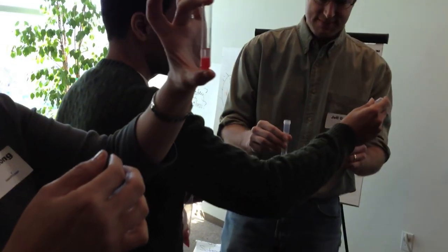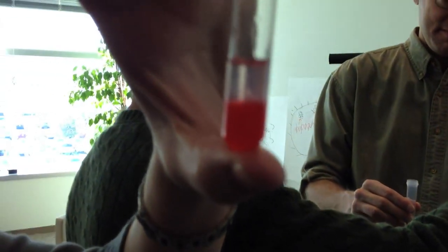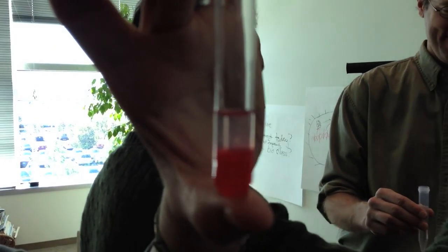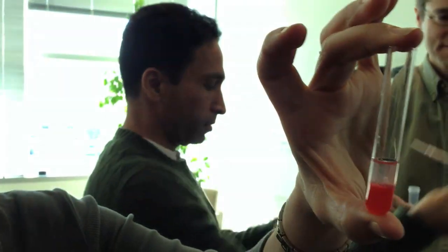Cool. So the two layers - you're going to have the isopropanol layer on top. Oh my god. And that's where the DNA is going to wind up. Oh my god. So in mine I can already see some. That is cool. See that little bit of DNA? Wow.